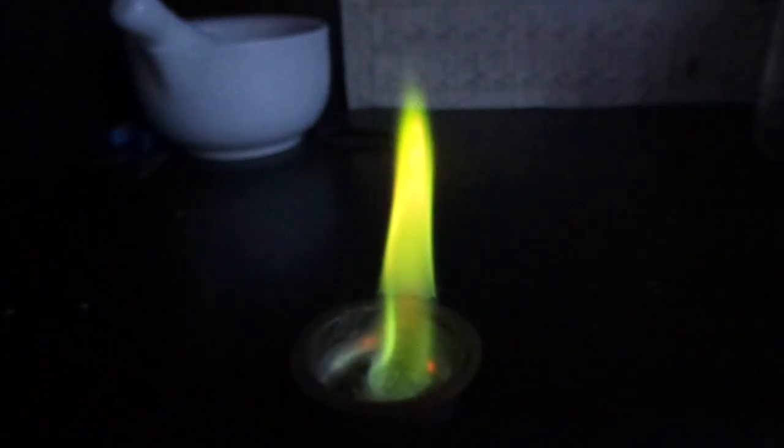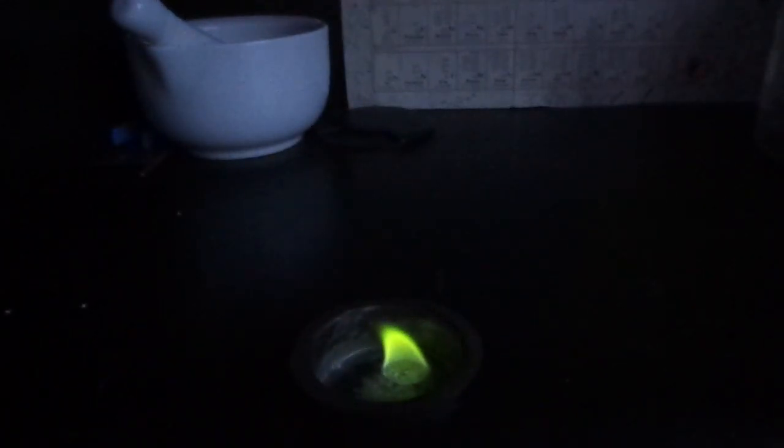Of course you can get this result with only boric acid mixed with ethanol, but here it's definitely much more visible. I actually have a video where I mix boric acid and ethanol and just burn it, and the flame wasn't so pretty. Here you can really see the green color.